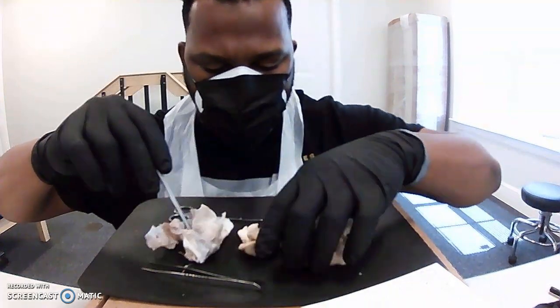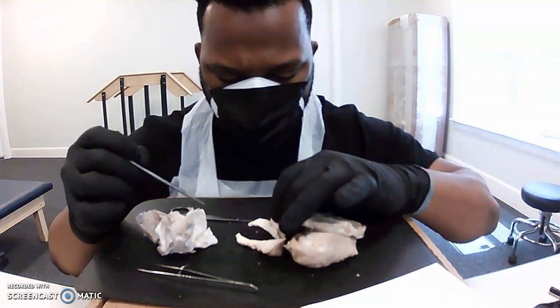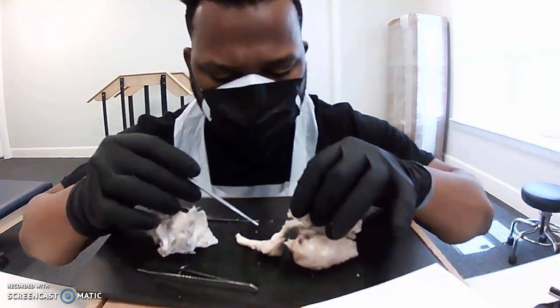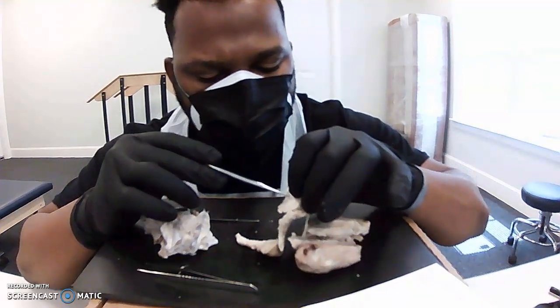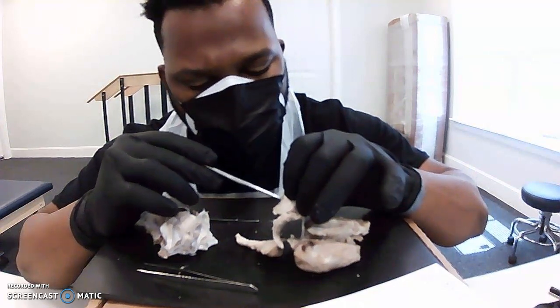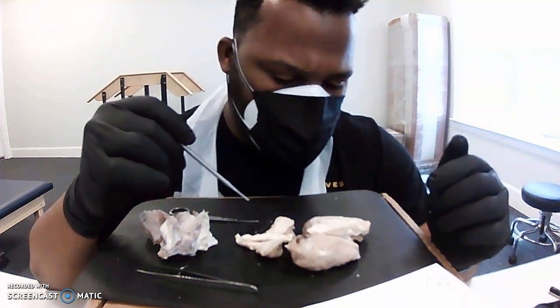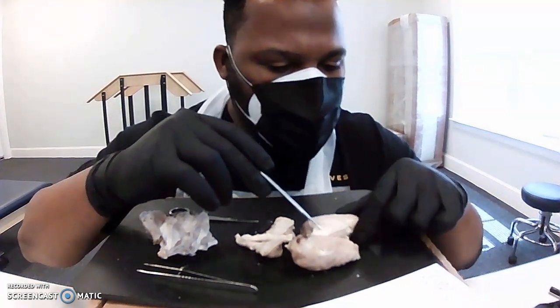And then down here we have our medulla right here. This is the cerebellum. And the white sort of tree branch pieces is the white matter, surrounded by the gray matter, the little bit darker. Let's see. Everything: corpus callosum, thalamus, hypothalamus, midbrain, yes.